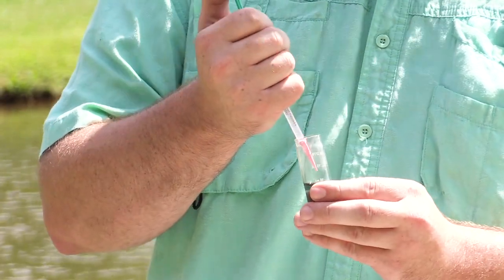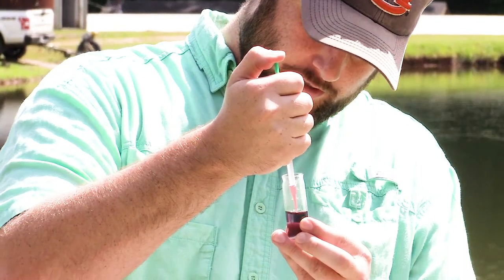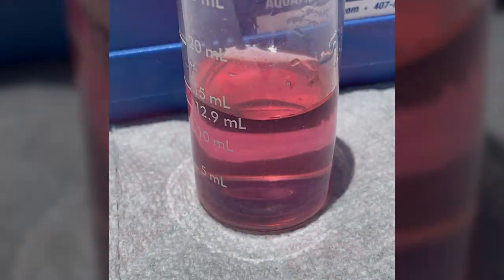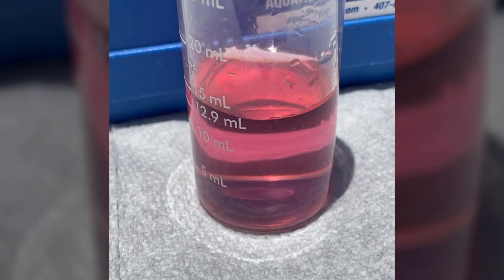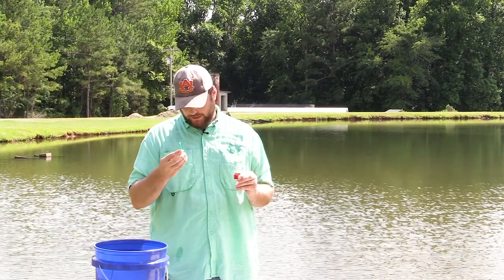As you can see, it's almost there. You just need to add a little bit more until you see the purple color change. Then you just read off your parts per million on here.